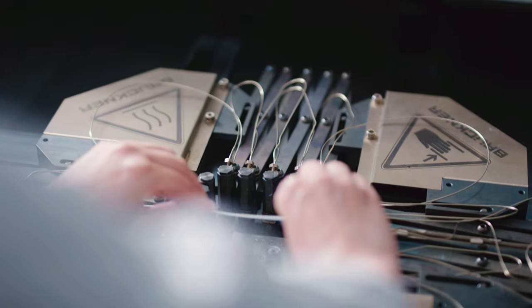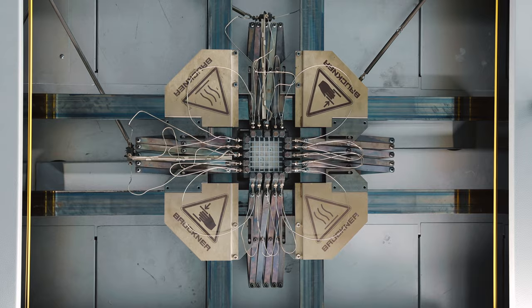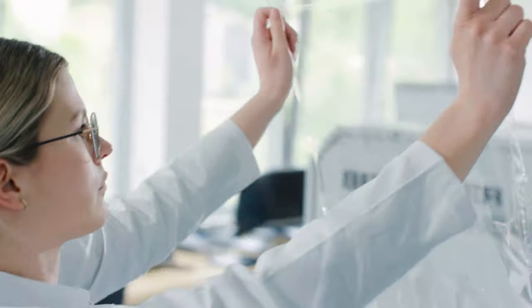Not only will we explain what we are able to accomplish with this machine, but we're also going to present a live demonstration about the actual handling and we'll stretch some samples together. But before we move on to our live demo and to the technical details of the machine, we'd first like to introduce the machine itself and its general features.